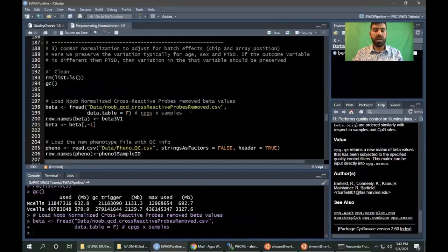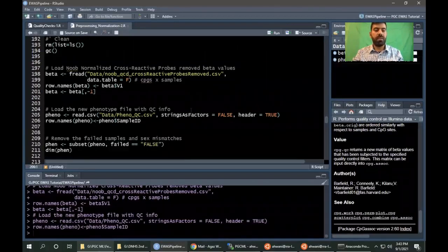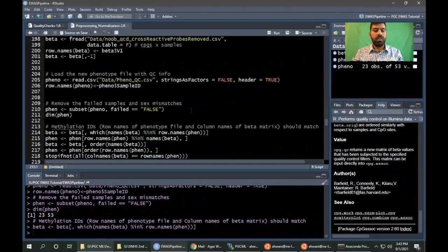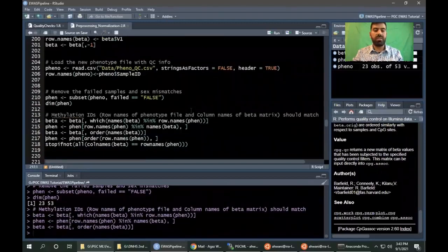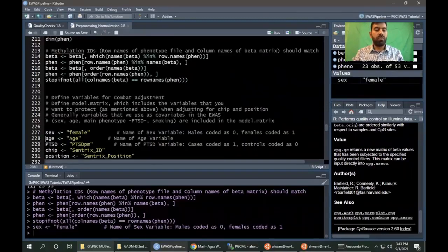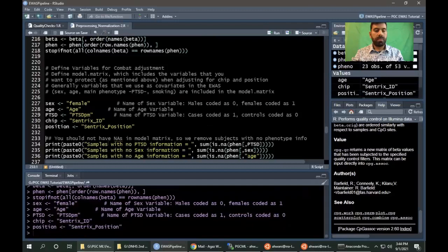So for ComBat adjustment, we have loaded the saved data and the saved phenotype data, and we have removed the samples that failed QC. Now we will sort the samples so that they are in the same order in the phenotype file and the methylation data file. We will have sex, age, PTSD, chip ID, and chip position. We will be using ComBat adjustment to adjust for the batch effects for chip ID and chip position, and save the variation for sex, age, and PTSD.